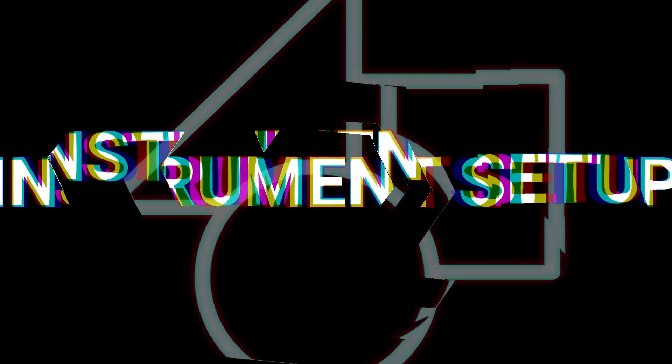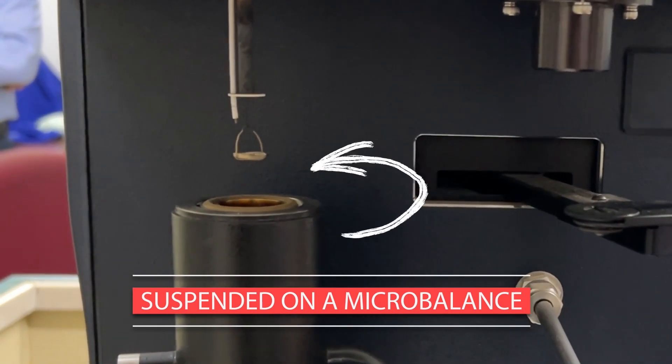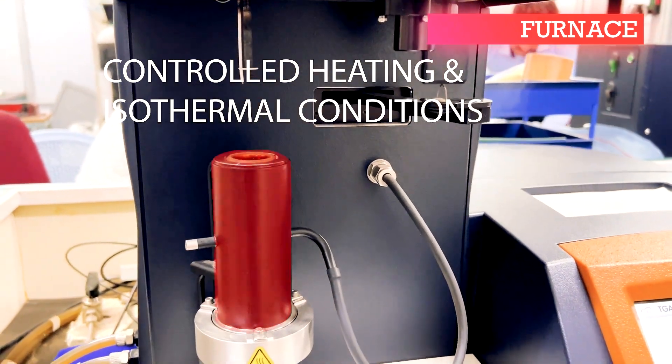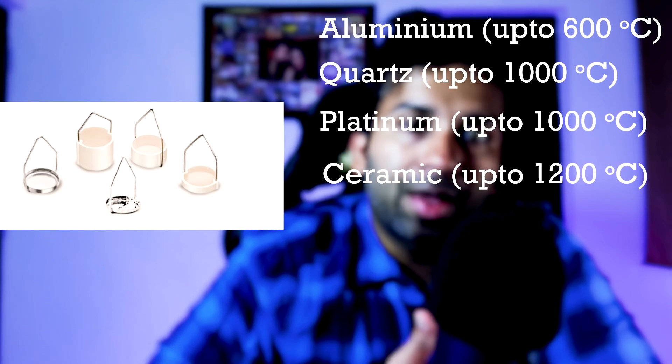The TGA instrument consists of a microbalance with high sensitivity capable of measuring weight changes in the range of milligrams to micrograms. It is also equipped with a furnace which is able to provide controlled heating as well as isothermal conditions. The instrument also contains a sample pan on which the sample is placed, and a reference pan which is used for calibration. Some of the commonly used pans are aluminum, quartz, platinum, and ceramic, with various lid options depending on the temperature being used as well as the type of polymer, so that it does not react with the pan.